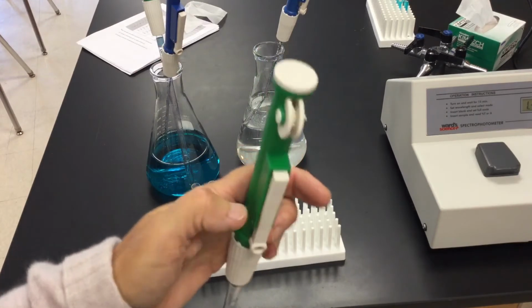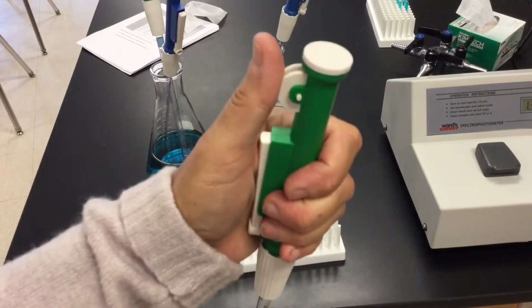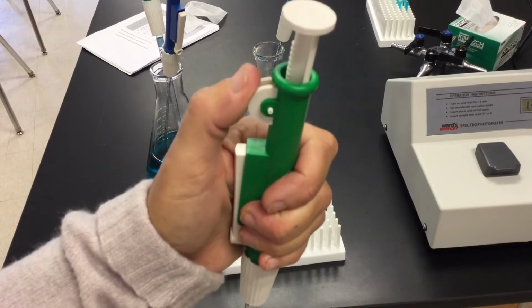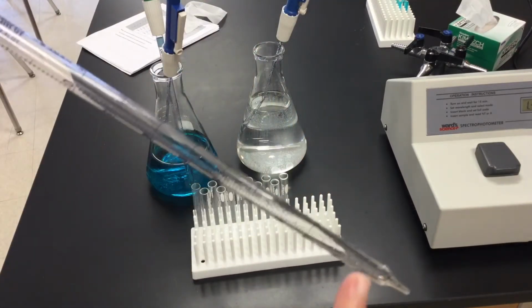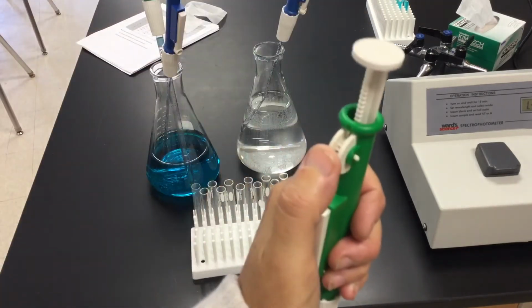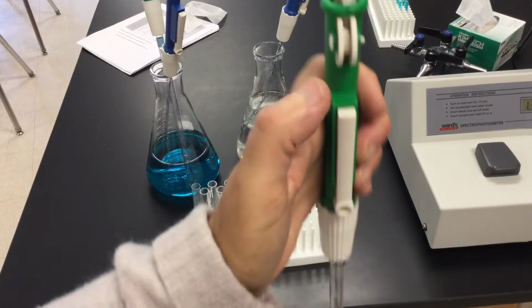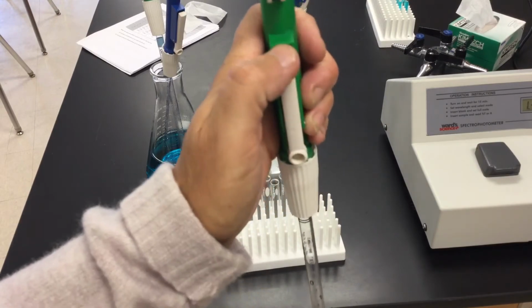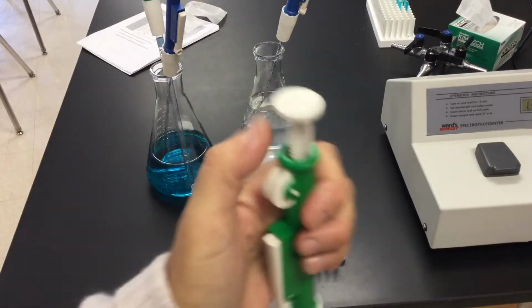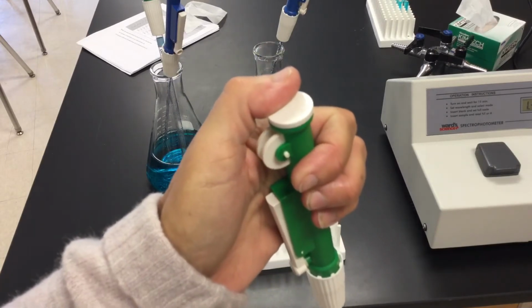This one's a little bit different. Instead of just pouring into a graduated cylinder, I would actually use a little dial here. And as I pull down this dial, you're going to notice the top comes up. It's actually going to absorb liquid up to the point where we need it. So it's very easy to measure. If you go too high, you release a little bit. It also has a quick release. So if I hit this button here, it's going to kind of slowly release the material out. You can release the material out just by pushing that button down as well.